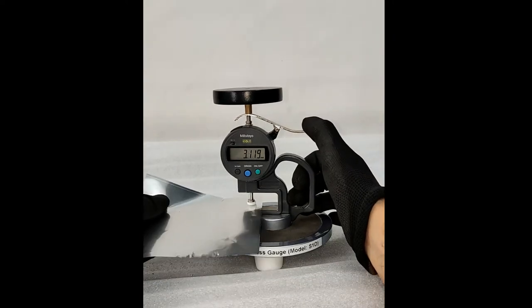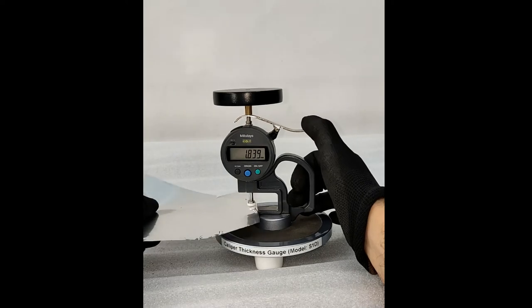You can test the thickness of aluminum foil used in food and pharmaceutical packaging.